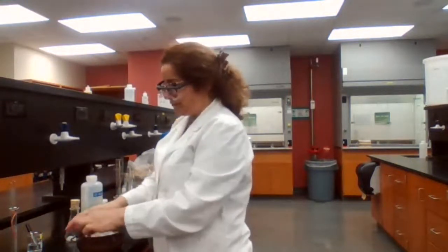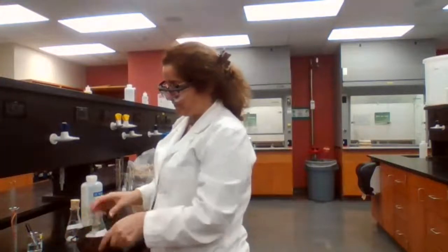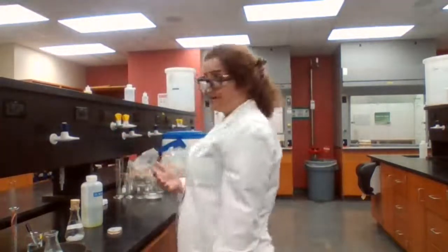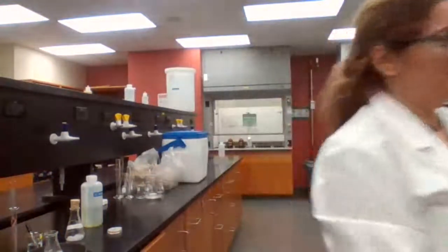We place in ice for how long? 5 minutes in ice, and then we run the vacuum for 5 minutes, and we place in the oven for 5 minutes.